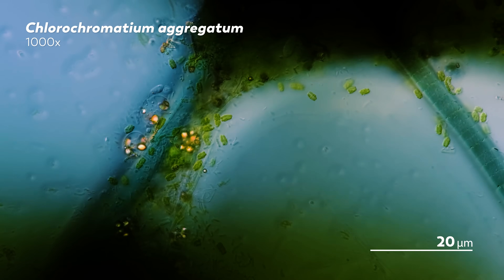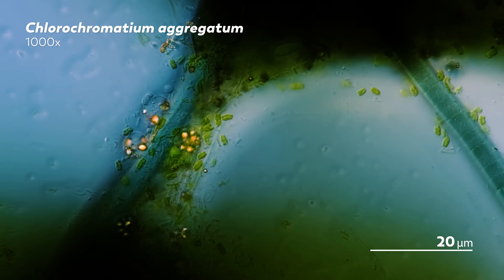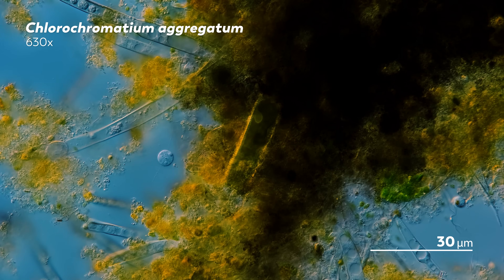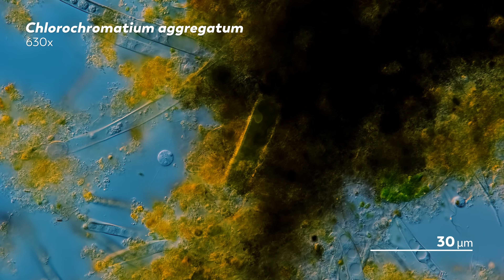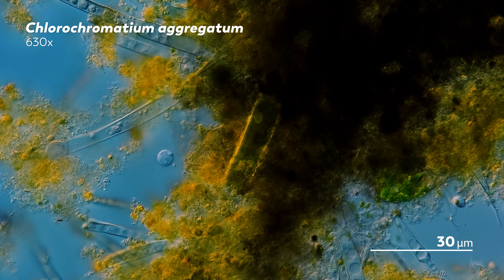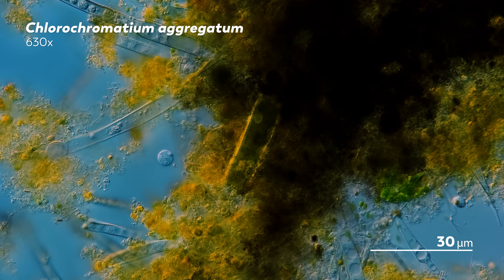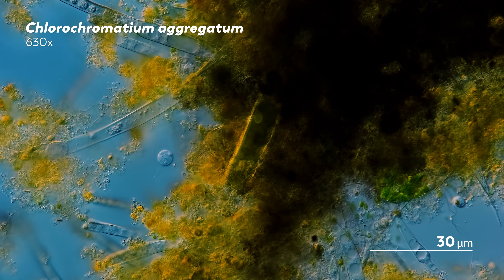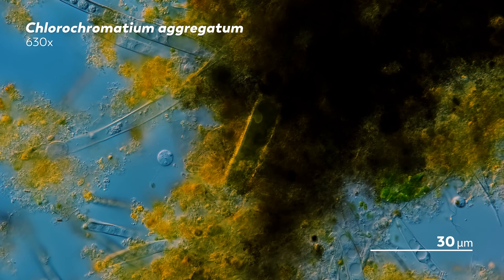And those two qualities describe a good chunk of what we find in the microcosmos. These particular little green organisms show up in the background of other organisms' lives, providing pops of color among debris.